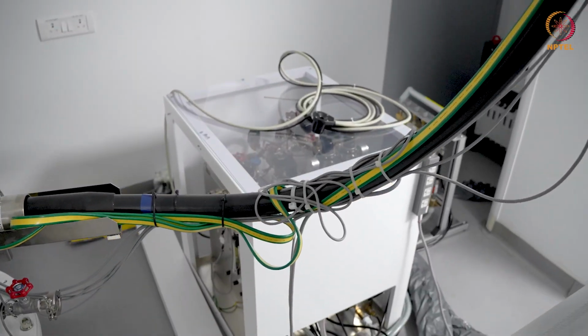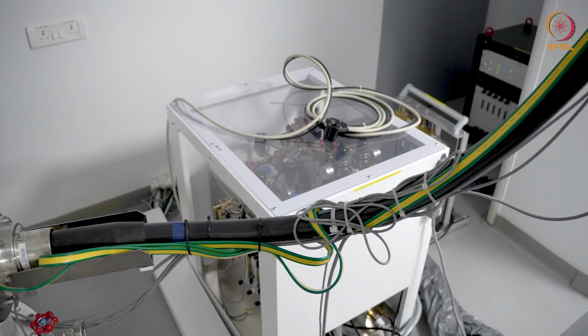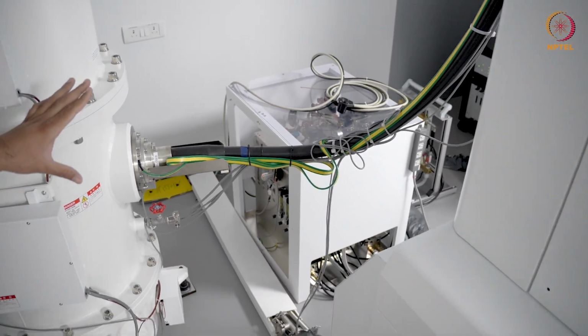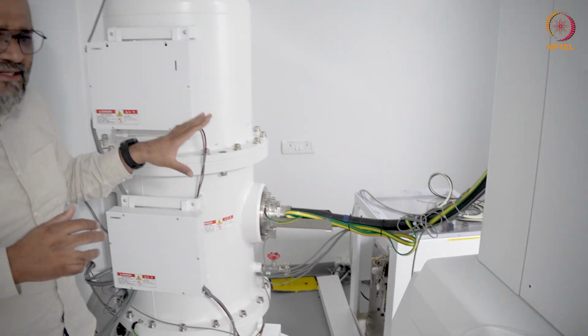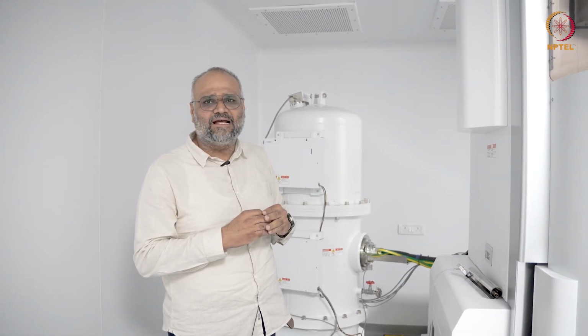This microscope actually aims at obtaining sub-angstrom resolution, and it is imperative that you ensure that all of these components are running properly. These are usually fine, but it is always a good practice to check if everything is fine, the levels of the water flow controller are at the right levels periodically.